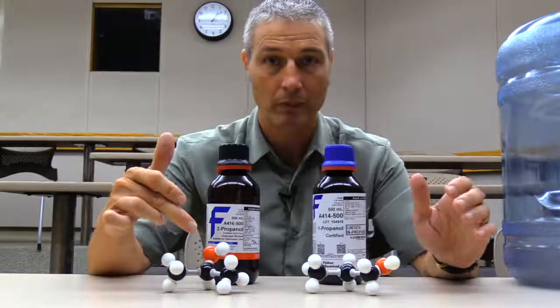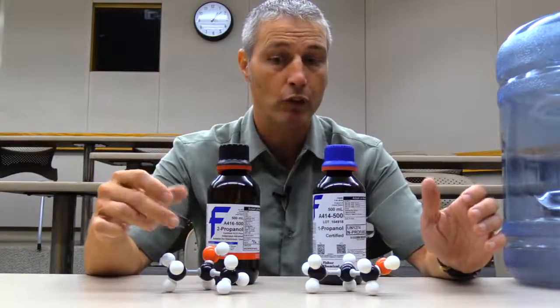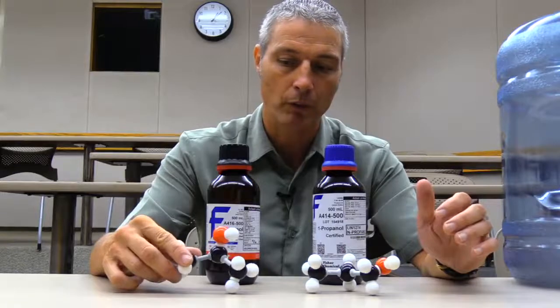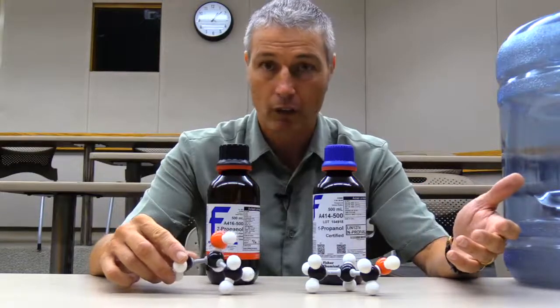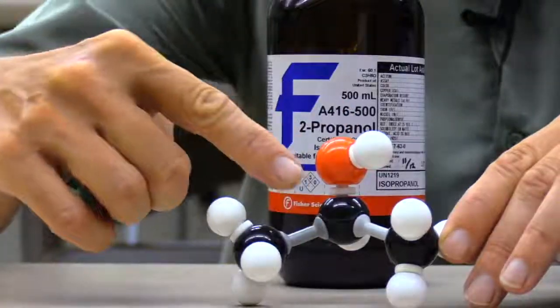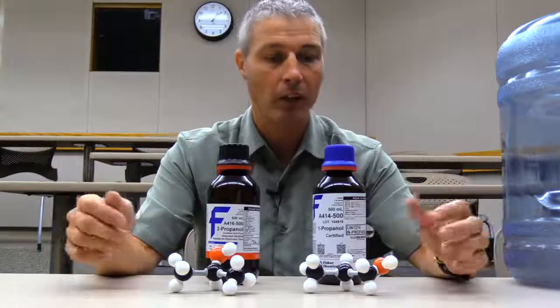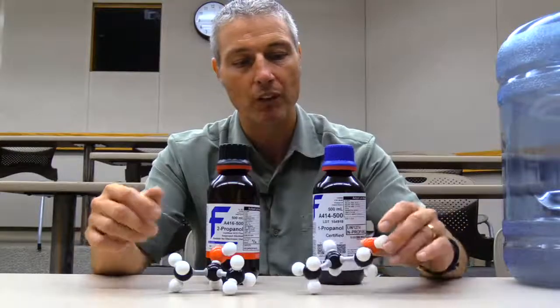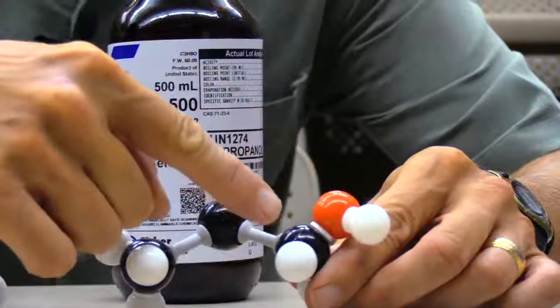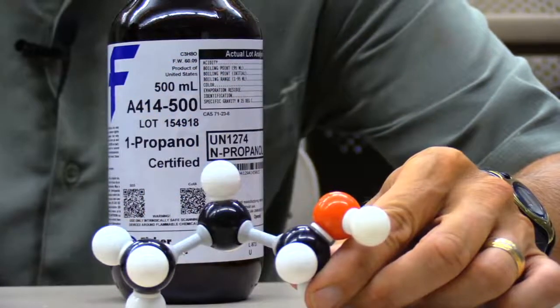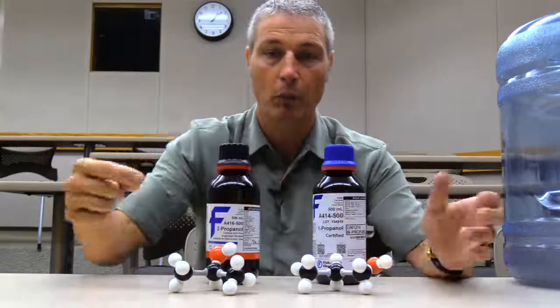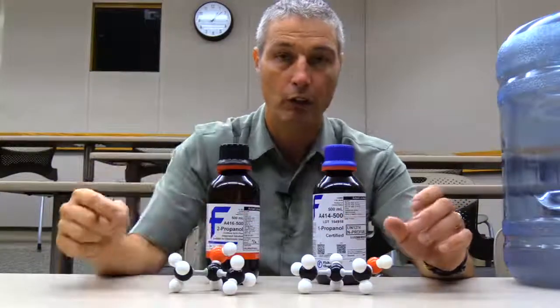So what we've got is the alcohol that we've used numerous times, called isopropyl alcohol or 2-propanol, and we're going to compare it to 1-propanol. Does it burn quicker or slower? The reason they have these names is the location of this alcohol group - the OH group. Here it's on carbon one, so 1-propanol. Here it's on carbon two, so 2-propanol.